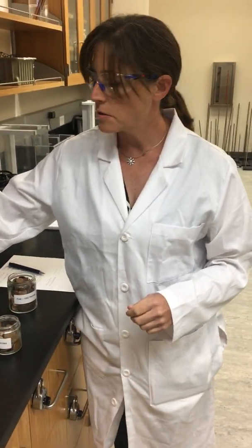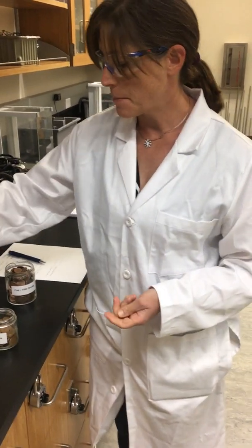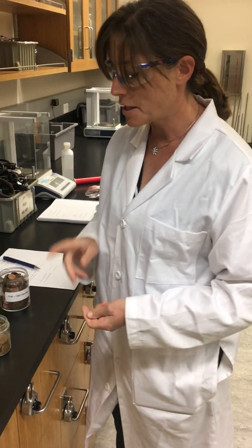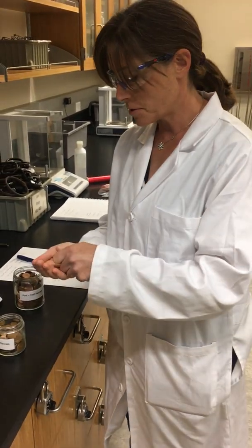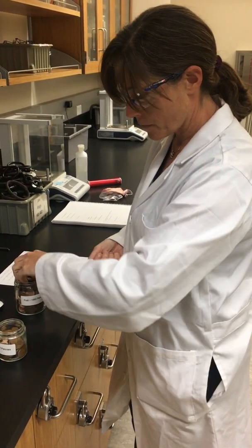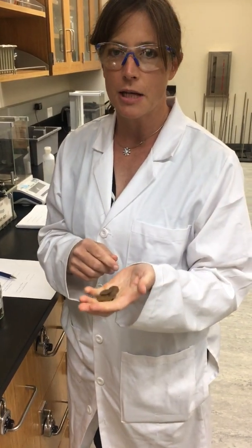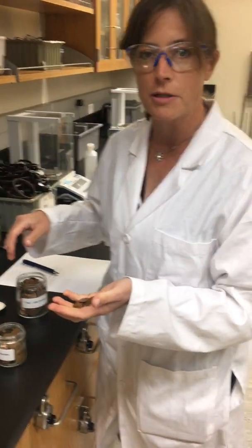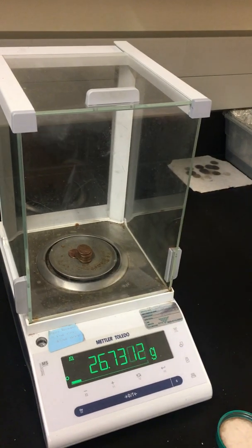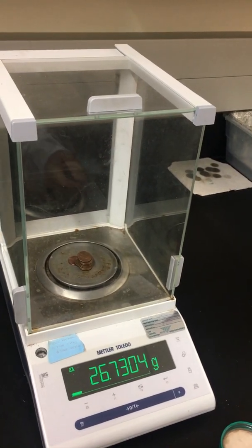Now you're going to use these masses to do the calculations. The last part that's actually measured is we're going to take the mass of our pennium sample. The pennium sample is made up of a mixture of the pre- and post-1982 pennies — 7 of our post-1982 and 3 of our pre-1982. This combination of both penny types represents our isotope mixture. We'll now take the mass, and our mass is 26.7304 grams.